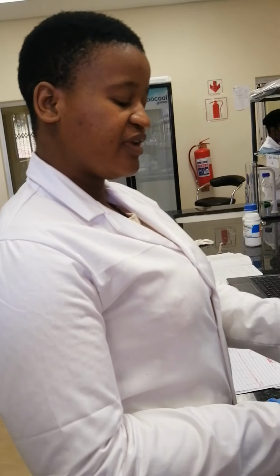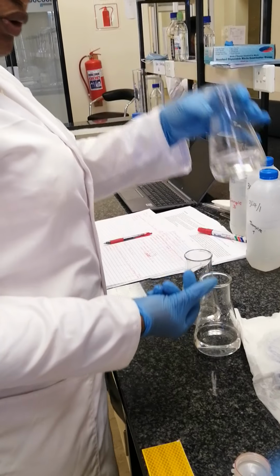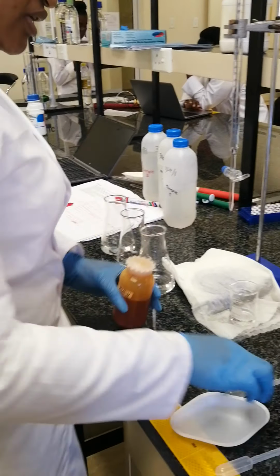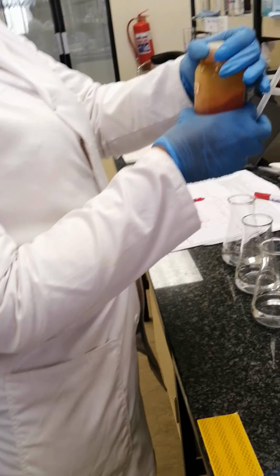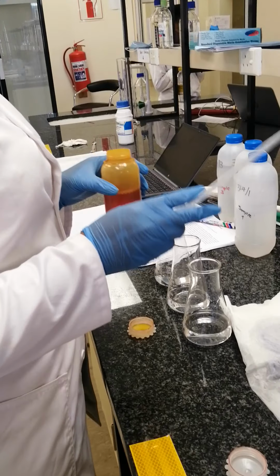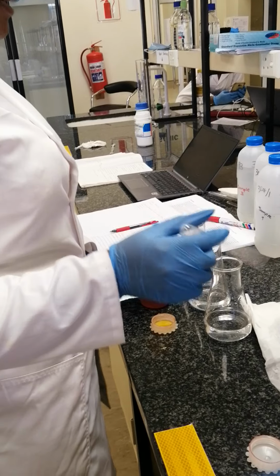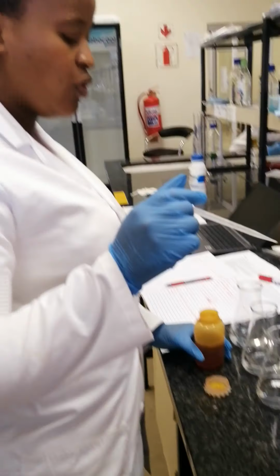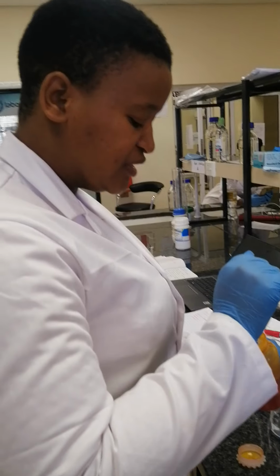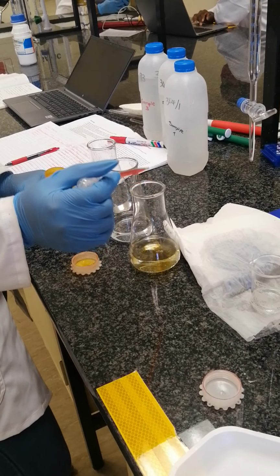After titrating with phenolphthalein indicator, the same water sample, you use the methyl orange indicator. Now you use methyl orange indicator for you to have your total alkalinity. Remember that one was for the phenolphthalein alkalinity. So when you calculate, you must know that the first volumes are for the phenolphthalein indicator. Then this one, the one that we are doing now, is for methyl orange, which is the total alkalinity. So now you can put the drops of methyl orange for your water sample to turn yellow.